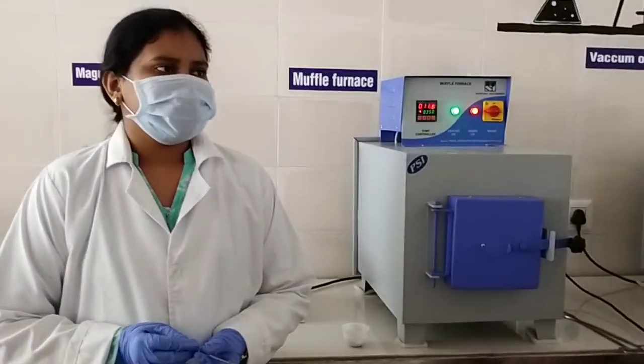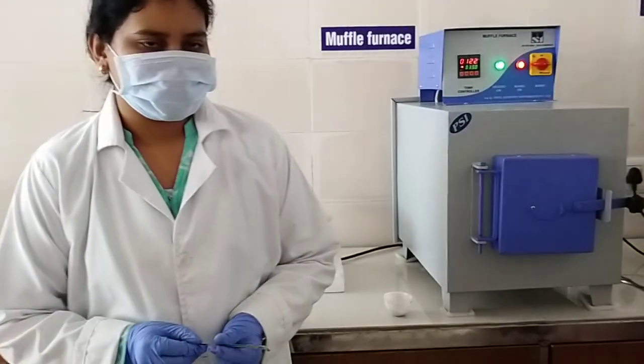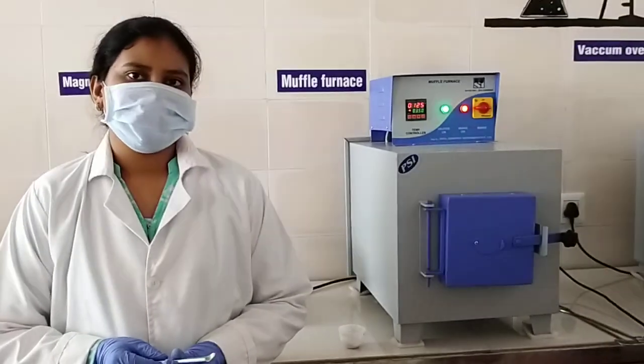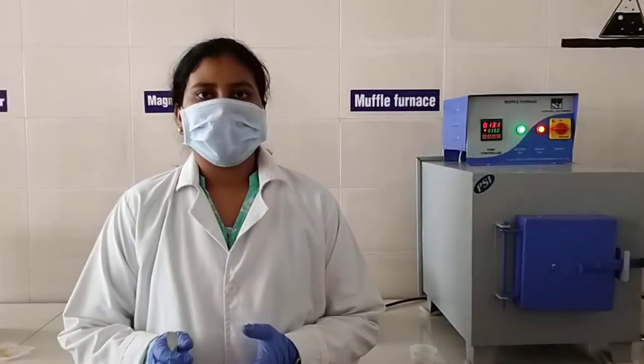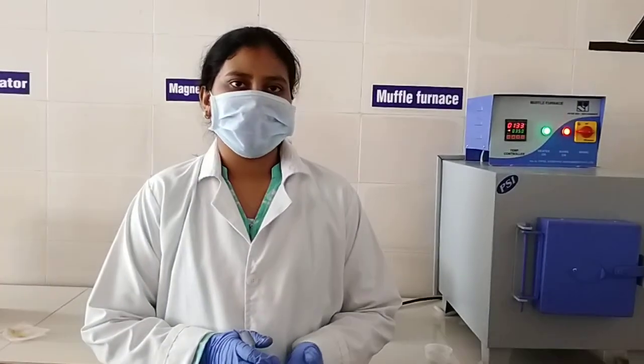So I think we should wait for a few minutes. Okay, let's go. Ma'am, as we have used ferrocene here, is there any other green alternative of ferrocene that we can use? You should use another alternative, but you should know what its substitute is and what its properties are, then you can replace it.